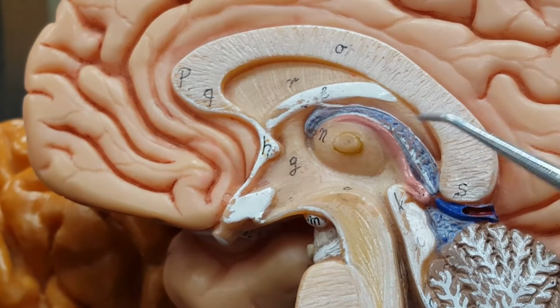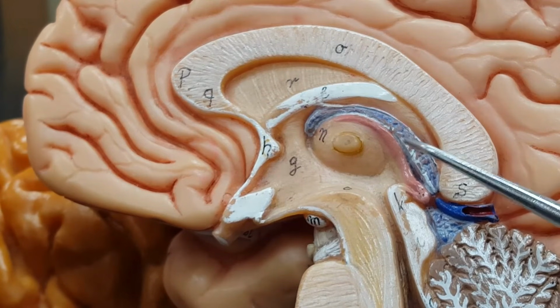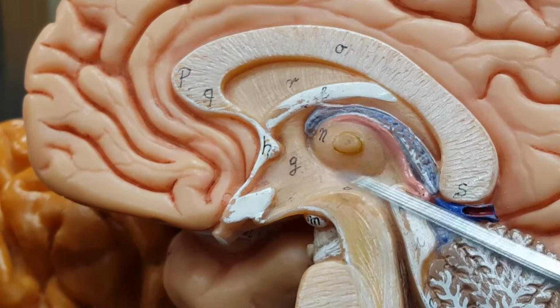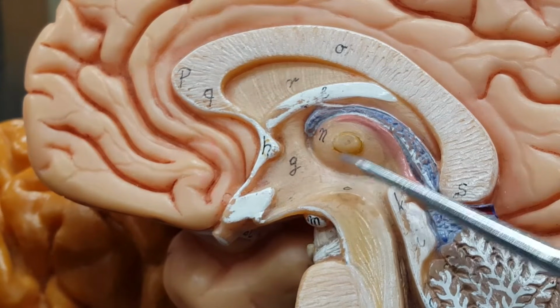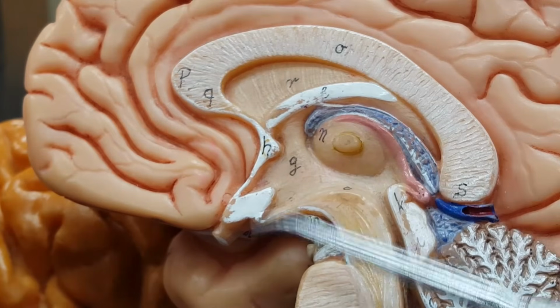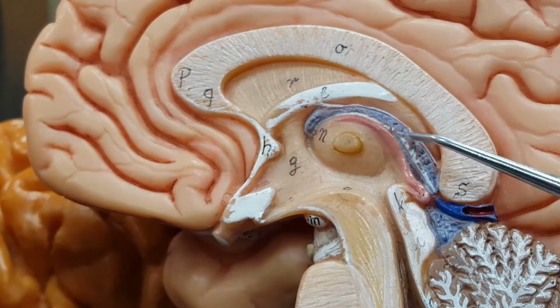I'm going to say that again. A choroid plexus. A network of capillaries that actually leak. Fluid comes out of this capillary, not blood, similar to blood plasma, which becomes that cerebral spinal fluid that gurgles around in these cavities. So you see this red and blue right here, that's a choroid plexus.